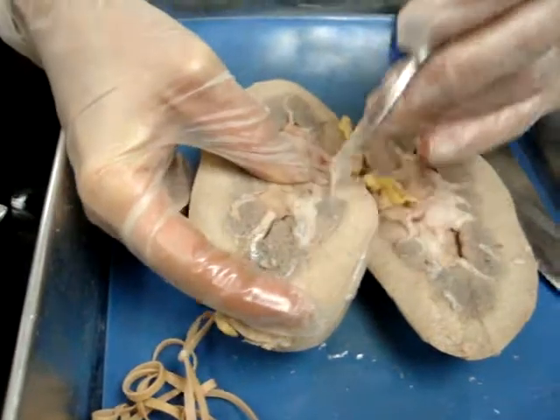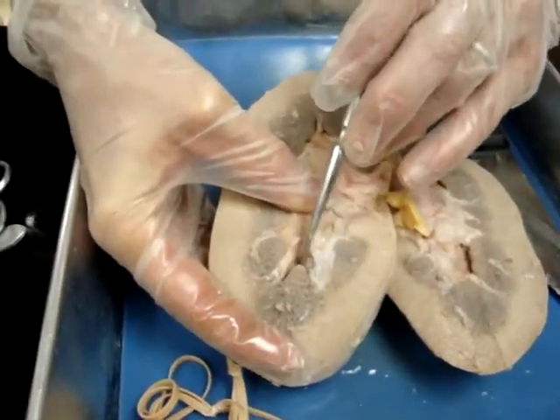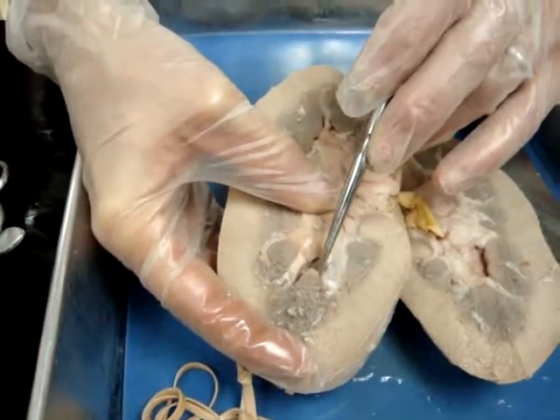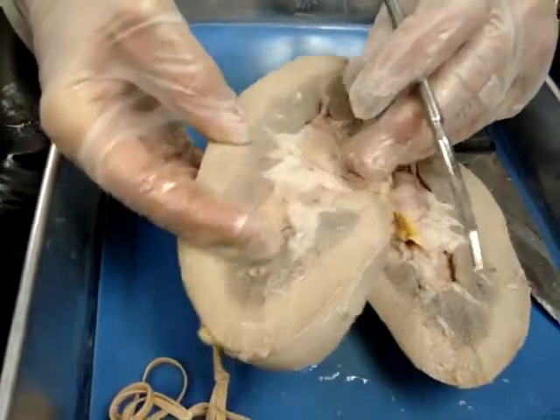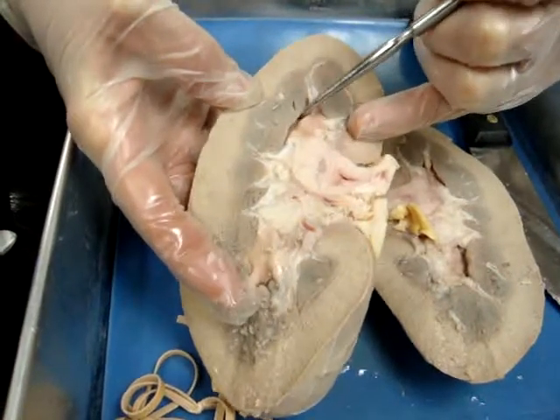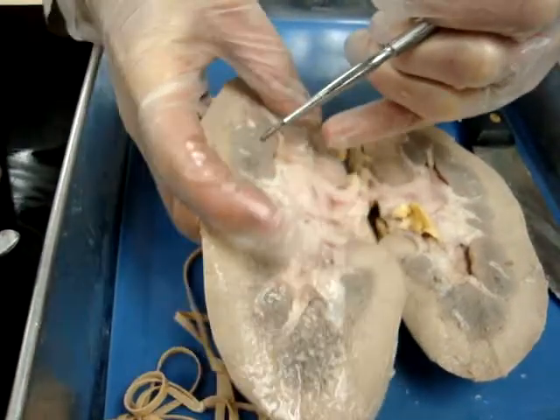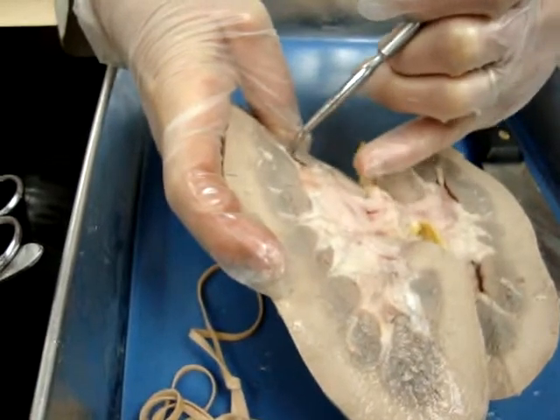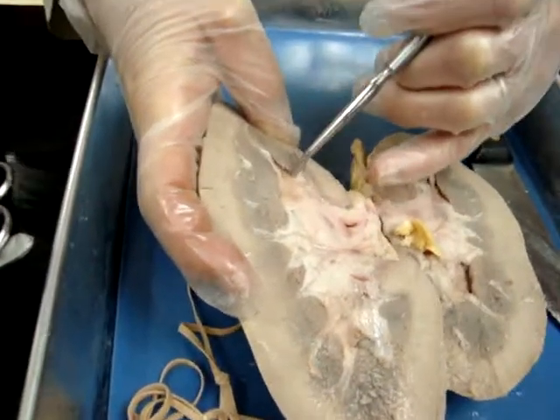Now see that space around the papillae — this space here? That's the minor calyx. You're going to see one around every papillae. You're going to see a minor calyx. You see one again over here too.